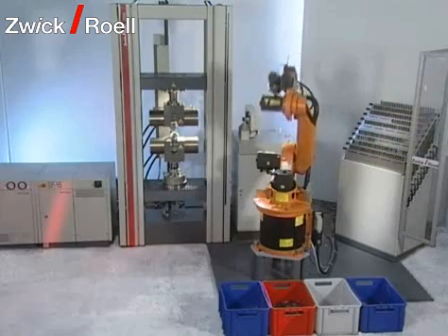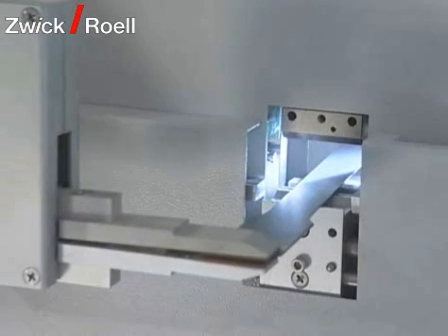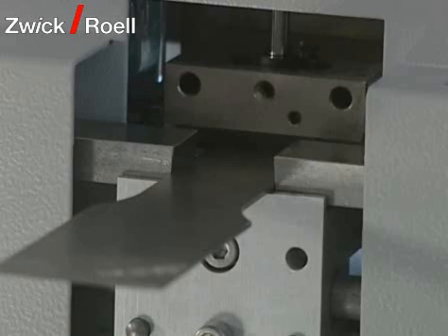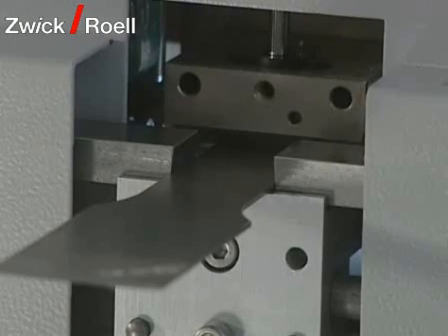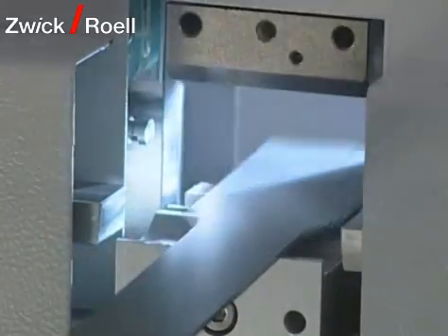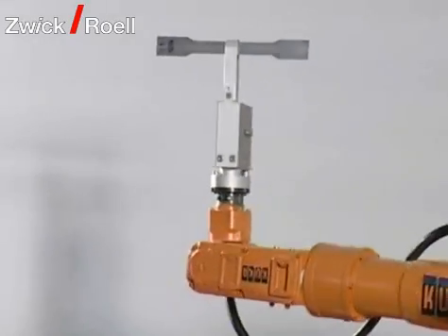The first measurement station after the removal of the specimen from the magazine is the cross section measuring device. Here, specimen width and thickness are determined by means of four sensor arms. Then the specimen is transported to the testing machine for the tensile test.